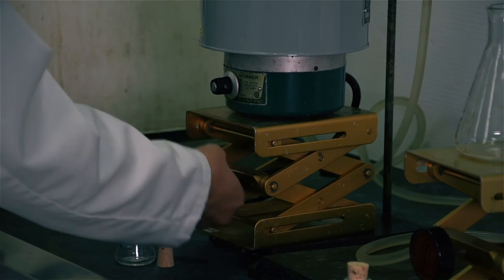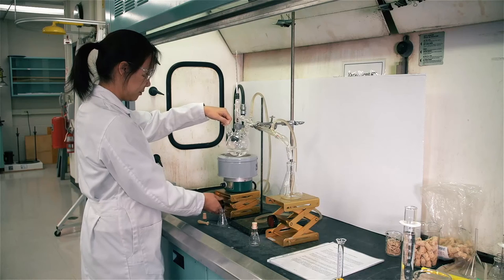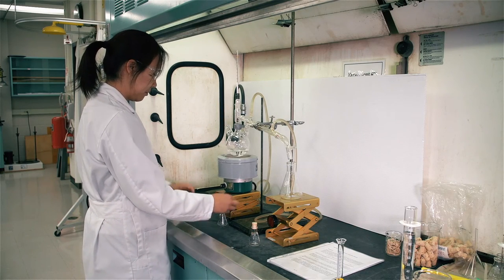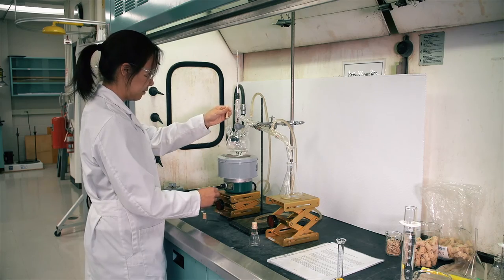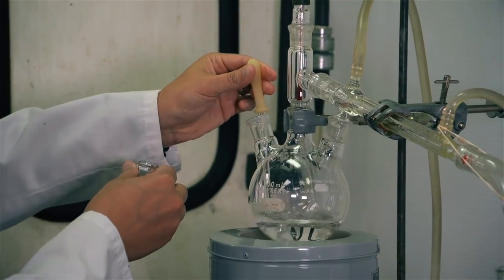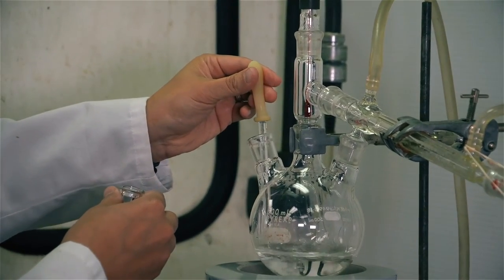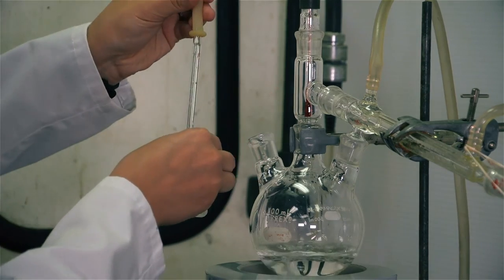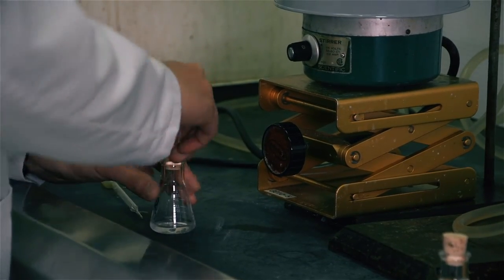Immediately lower the heating mantle and collect sample 1R by removing one of the stoppers on the round bottom flask. Insert a Pasteur pipette, pump it 3 times, withdraw the sample and deliver it into the sample flask. Stopper the flask.